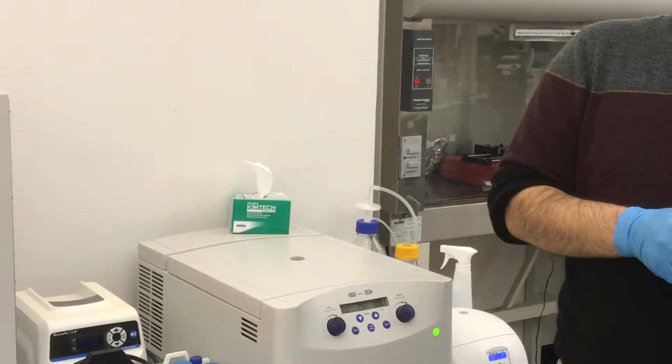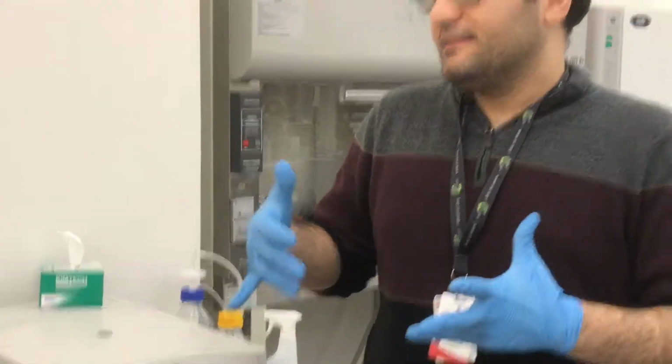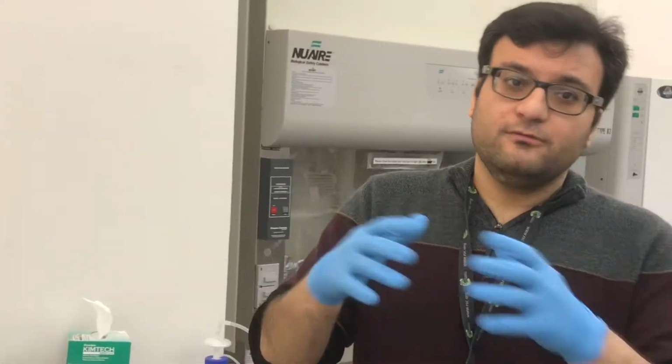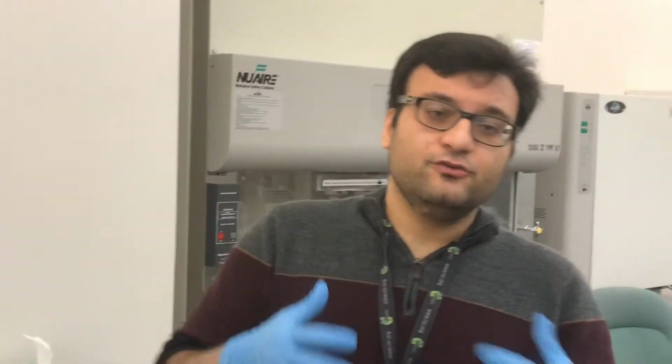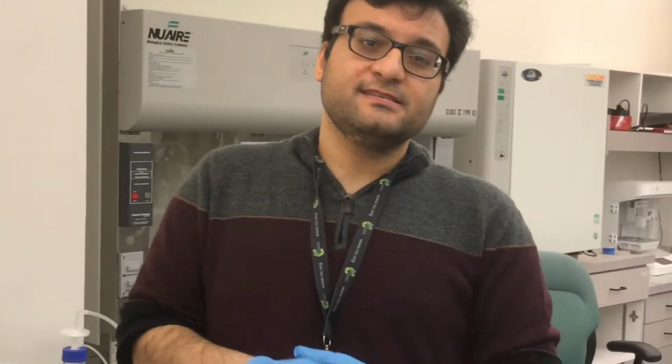Some curing agents are activated by UV, some are activated by heat. For example, this curing agent specifically is activated by heat. It means the structure of the curing agent changes, covers the whole area of the PDMS, and changes it from a solution to a solid. It means they decrease the space between the PDMS. In our case, for the chip we always use heat-activated. Okay.